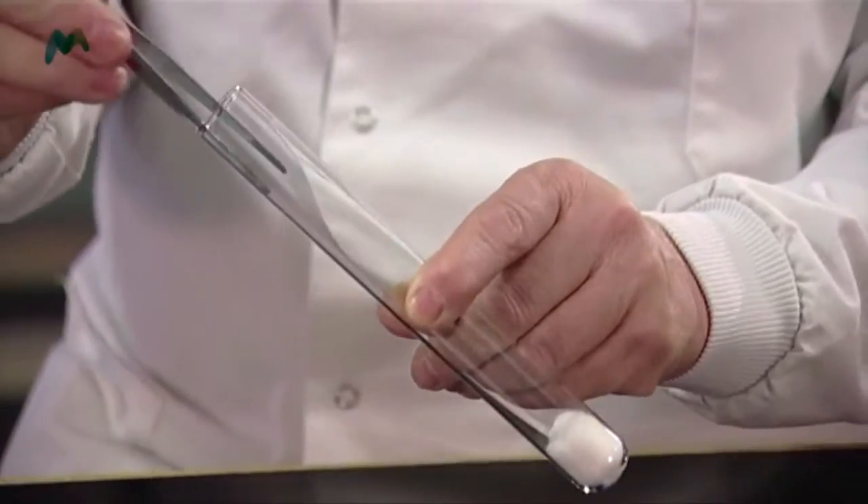I need to remember to make sure to put them in this way round. If I put them in the wrong way round then I can't take them out properly. So I've remembered to put them in the right way round.